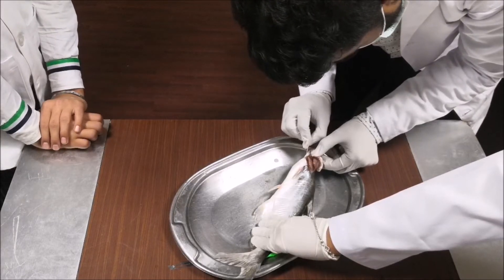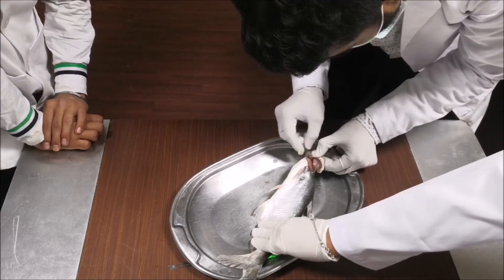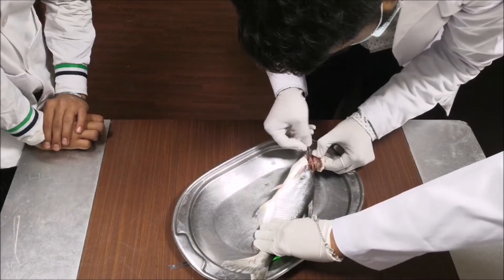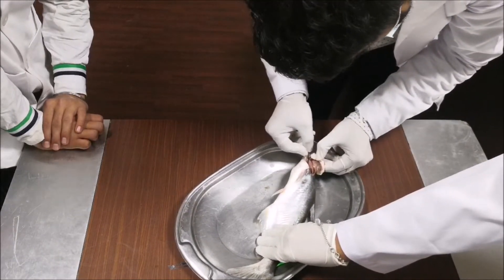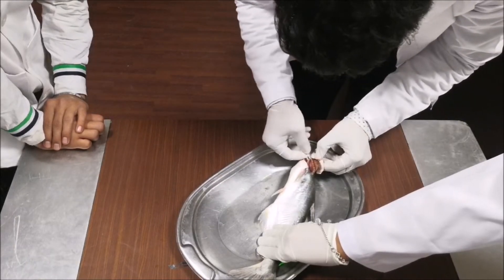How many gills are there? Four. There are four gills. I'll take all four.